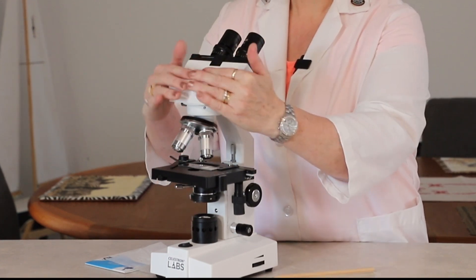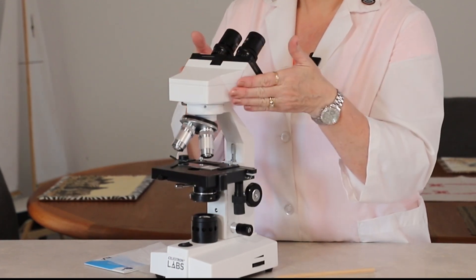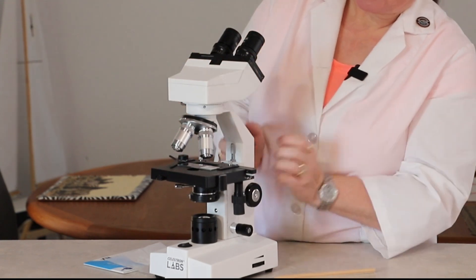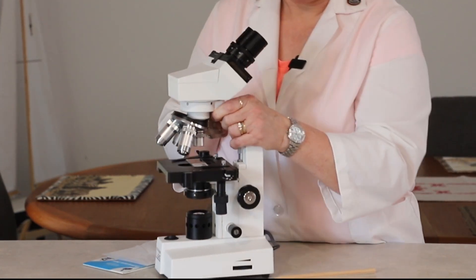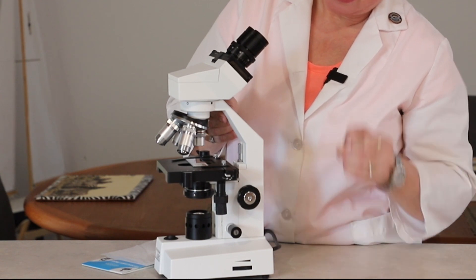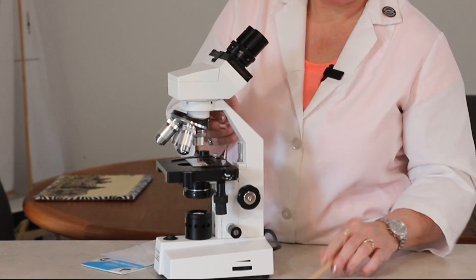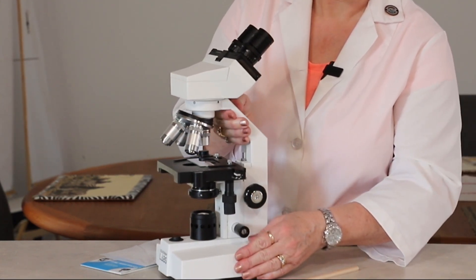We have the body tube, which in this microscope is here. We have the arm — this is the arm that leads to the base. The base holds it all together.